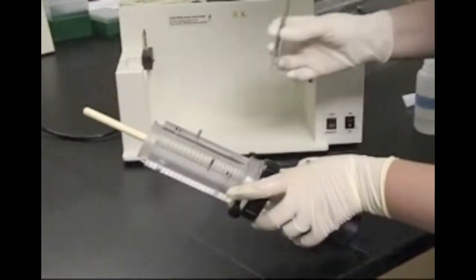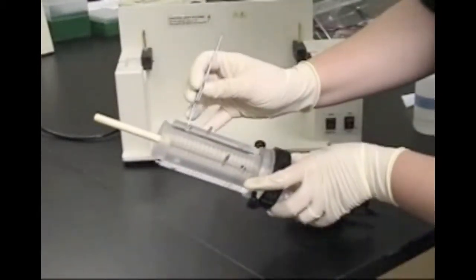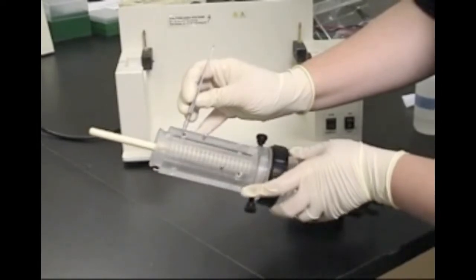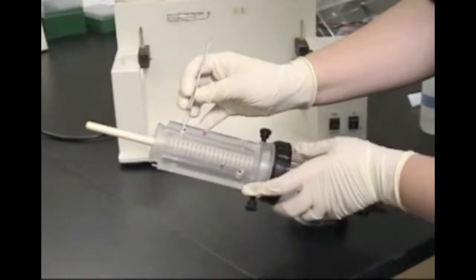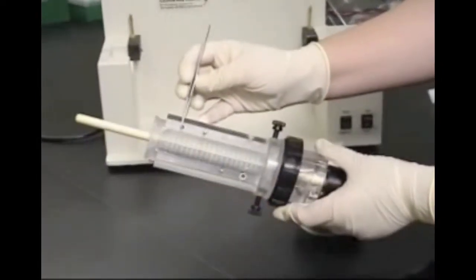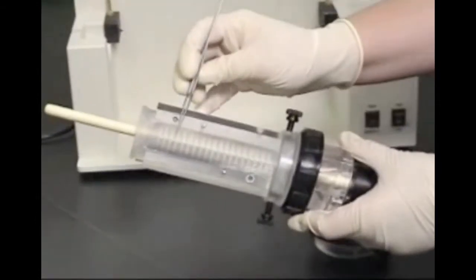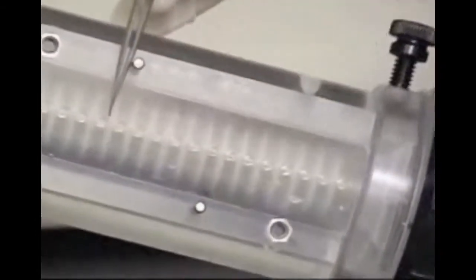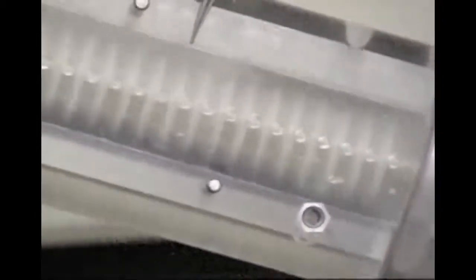At this point, it is important to check the alignment of the ports on the focusing chamber with the membrane core. Remember, each membrane screen should lie just between two ports. If they don't, remove the focusing chamber and adjust the position of the membrane core as required.